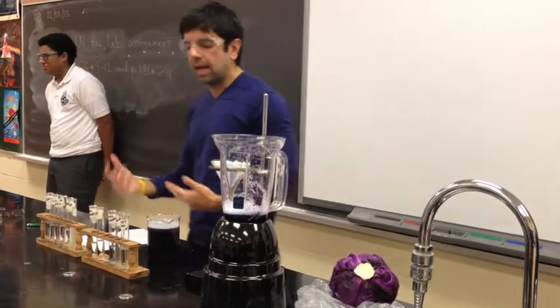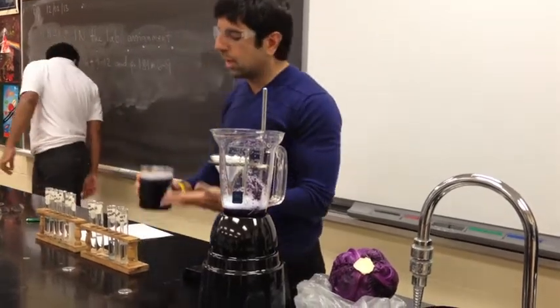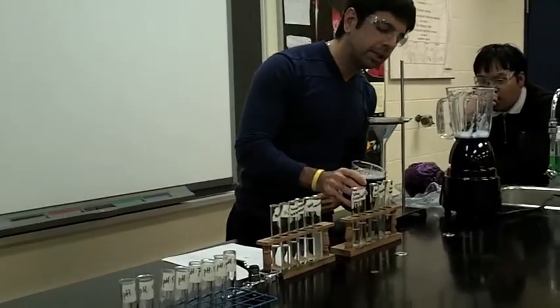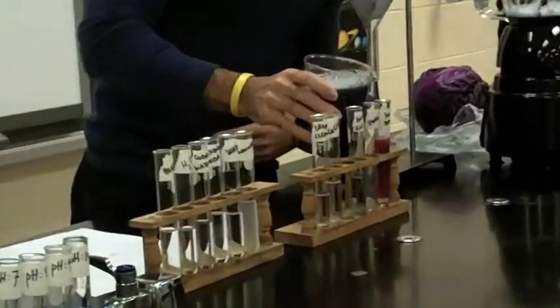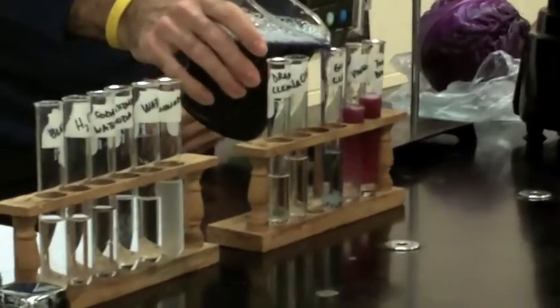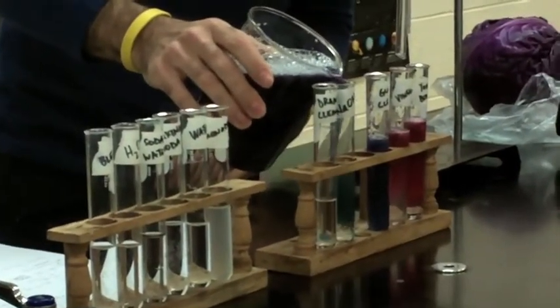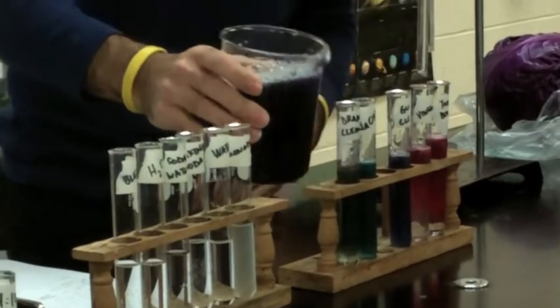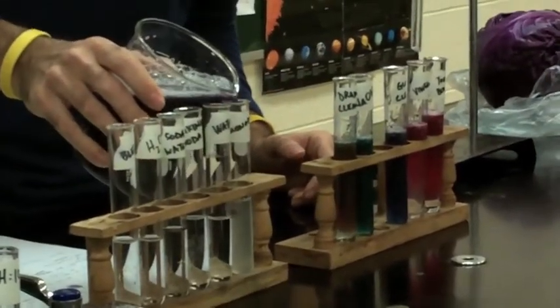So I'm going to place a little bit of each of these in the test tubes — notice the color changes. I don't think I did a great job of filtering out the pieces, but notice now the different colors.